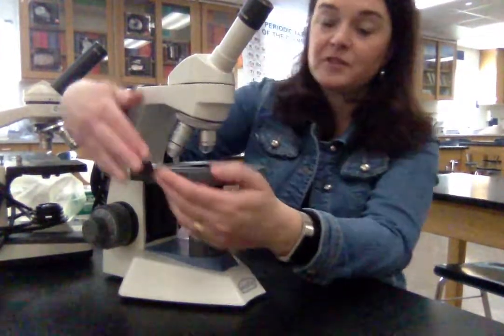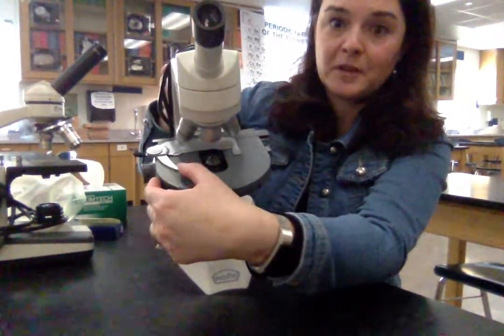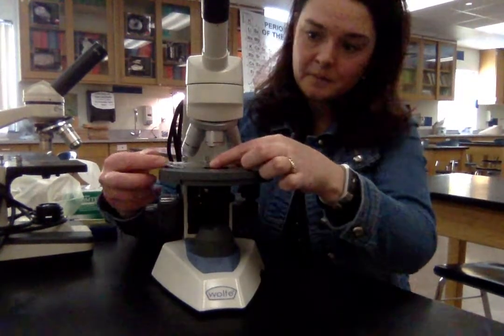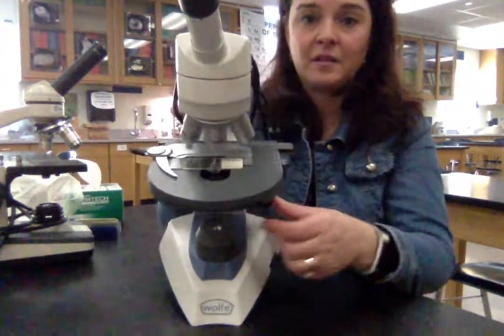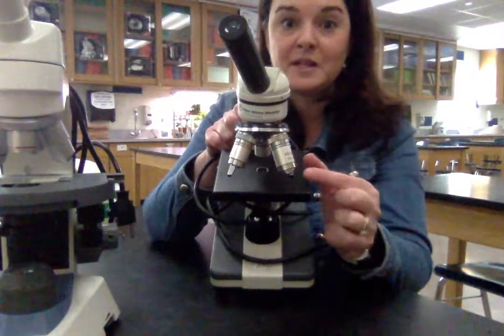These new stages have a spring-loaded clip — kind of like a claw that holds the slide into place. Underneath the stage, you can use knobs to move the slide around. On the older microscopes, instead of a nice claw, we had two clips and had to physically move the slide around to look for our specimen. This newer design takes the guesswork out of which way to move the slide.